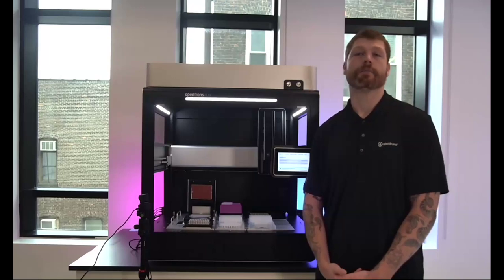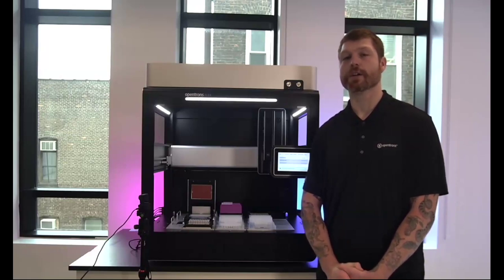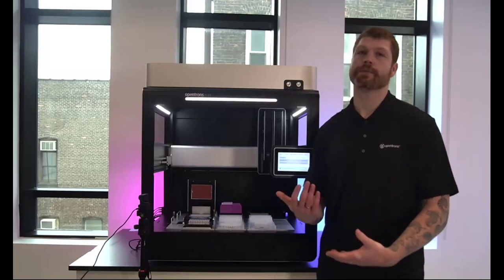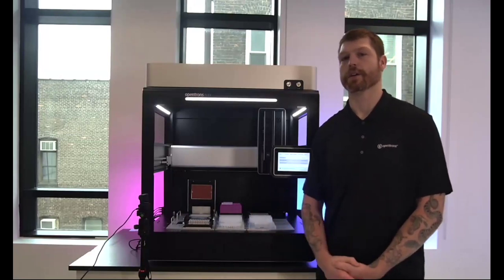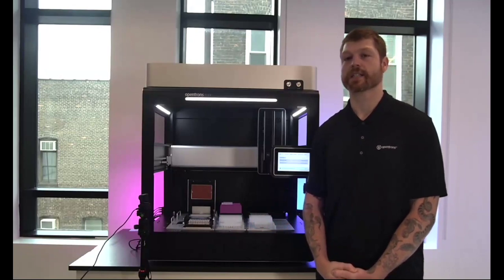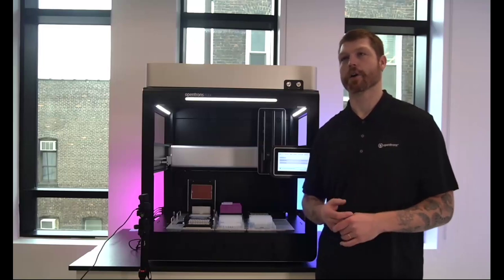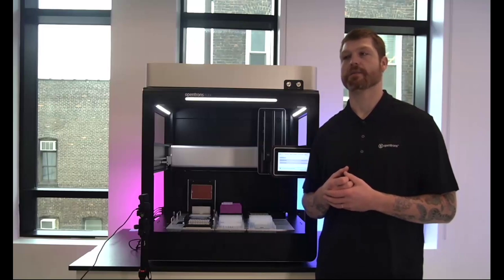Are all of the features that you mentioned today available for both OT-2 and Flex, or are some of them Flex only? So overall, the software packages influence both the Flex and the OT-2, and so a lot of the background code is shared between the two of them. So CSVs and things like that are possible to be used with the OT-2. Anything that's specific to the feature sets that the Flex has that the OT-2 does not, such as the touchscreen or the gripper or the 96 head, right? Those are going to be Flex specific. And so quick transfers and partial tip loading with the 96 head are not going to be applicable to the OT-2, but things like partial tip loading with the 8-channel and the ability to utilize CSVs are.